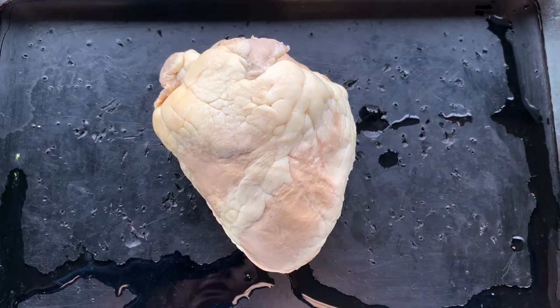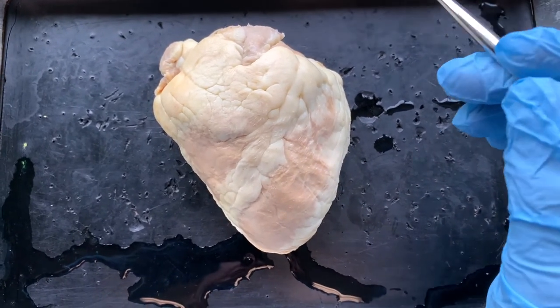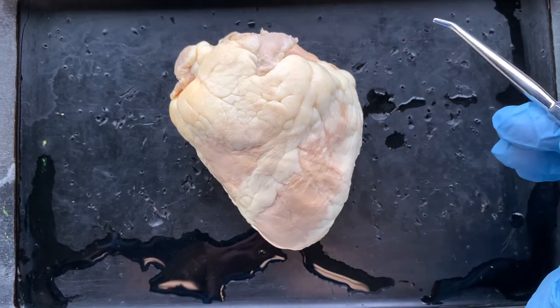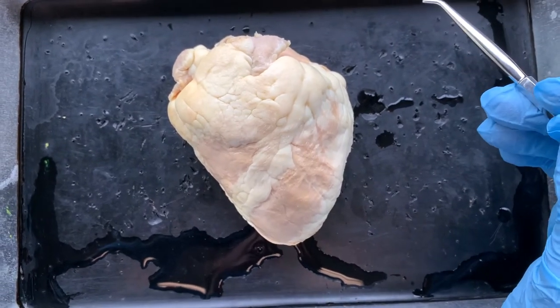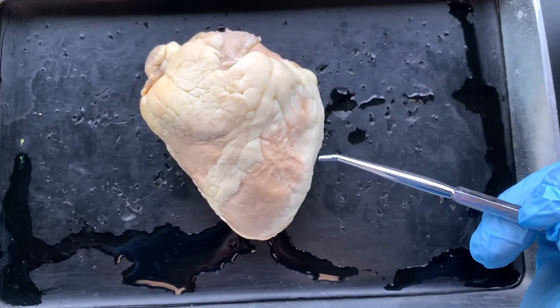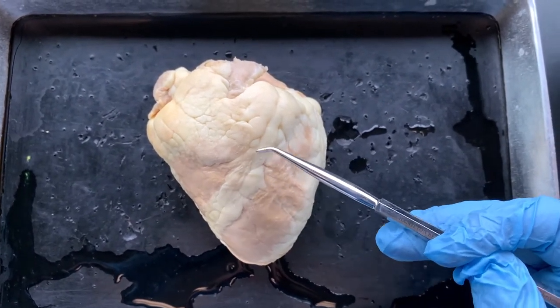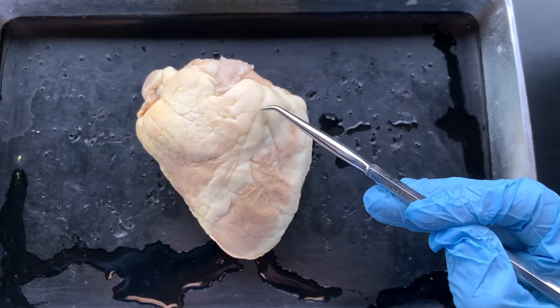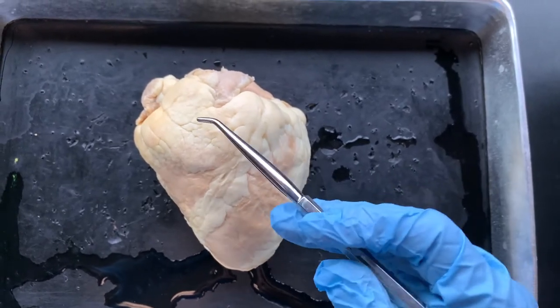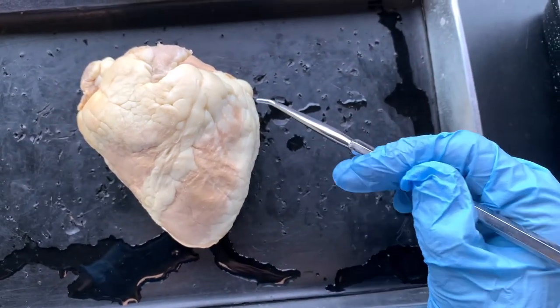Let's look at the sheep heart, in addition to the videos that you'll have access to in the PowerPoints or via link, just to orient ourselves based on some things we learned in the laboratory about the human heart. On the sheep heart, if we're thinking about how we can orient ourselves to the anterior of a sheep heart, we can see clearly that we've got an anterior interventricular sulcus. The coronary vessels are hidden under the fat that you see, but you can see this line here. So this would be the right side of the heart, and this would be the left side of the heart.